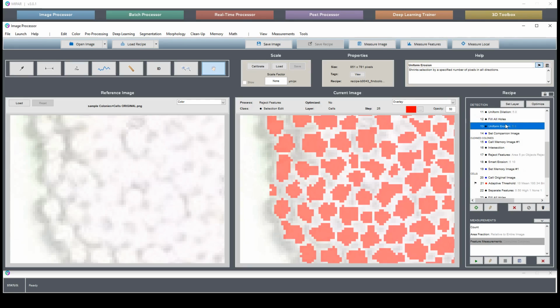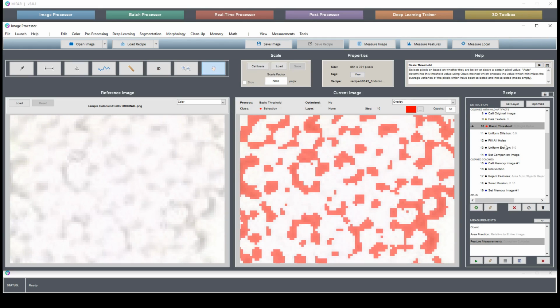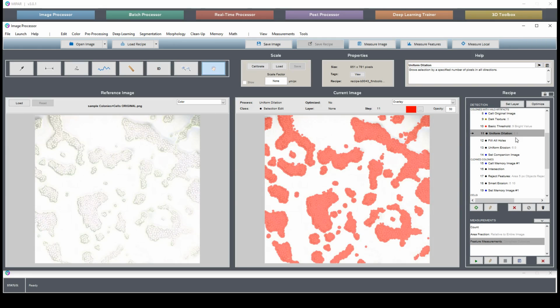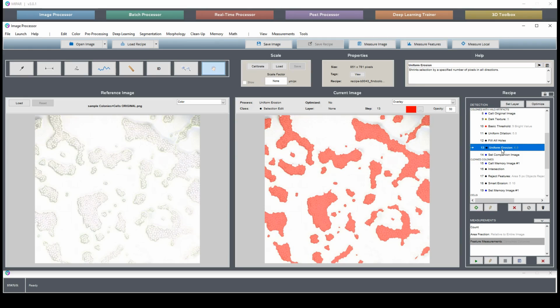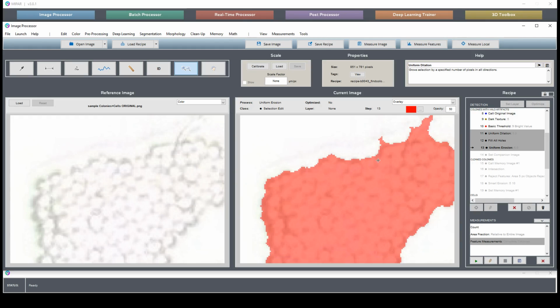So how do we fix this? Well, our dilation and erosion, our closing, was a little bit too strong. But it needed to be this strong in order to fill in all this stuff in the center. Right? We needed to dilate that much so that we could then fill holes and erode away. So what we can do here is segment the centers of these colonies separately from the edges. The purpose of this closing was to fill in the centers, but we can have a different couple of steps which set these edges precisely where they need to be.